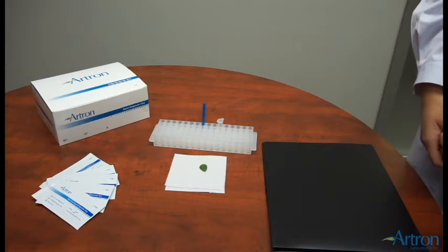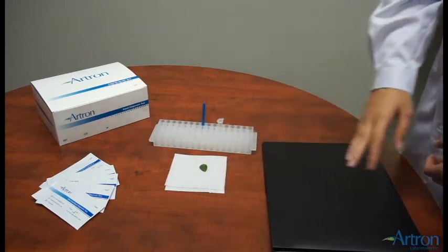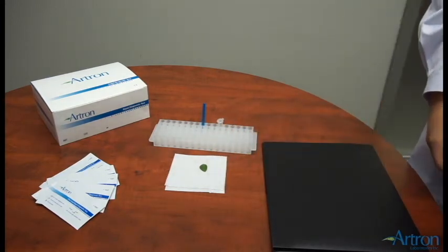This test can be used to test leaf and seed samples. In this video, I will be demonstrating the leaf testing procedure.